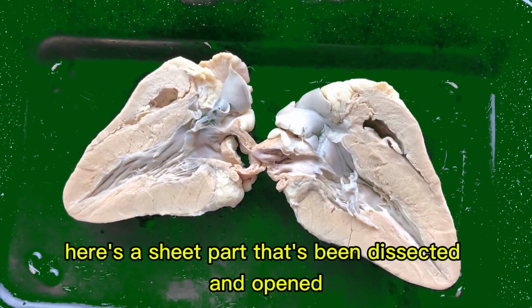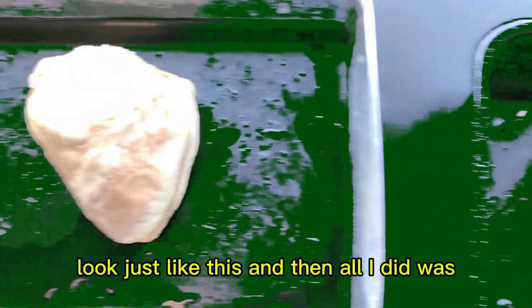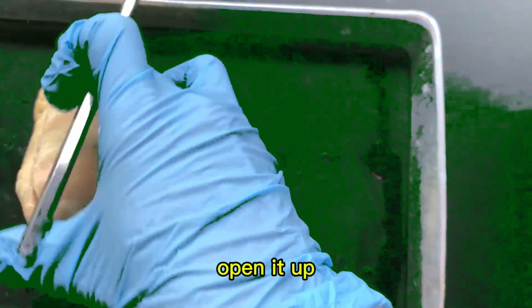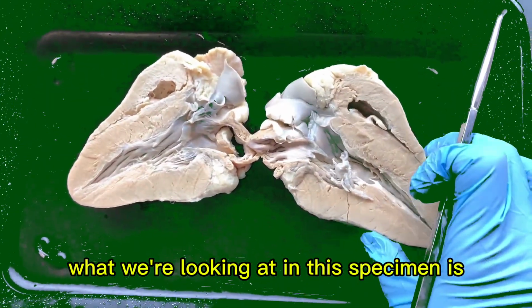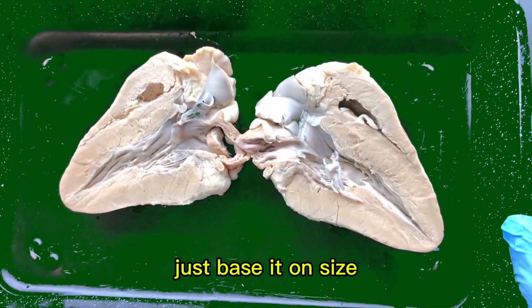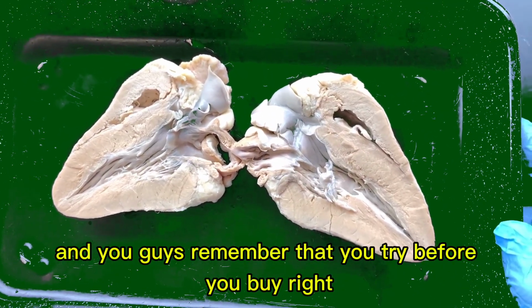Here's a sheep heart that's been dissected and opened. It looked just like this, and then all I did was open it up. Okay, so what we're looking at in this specimen is we can see the right and left ventricles. Just base it on size. And you guys remember that you try before you buy, right?